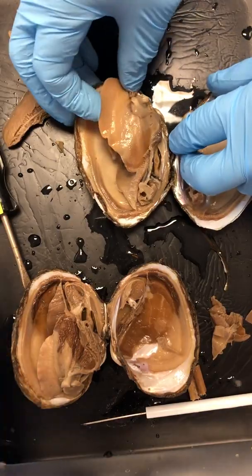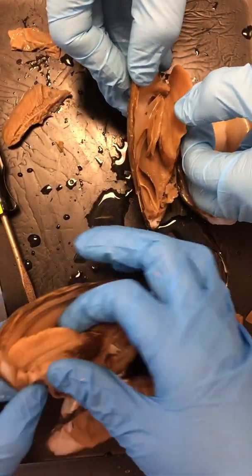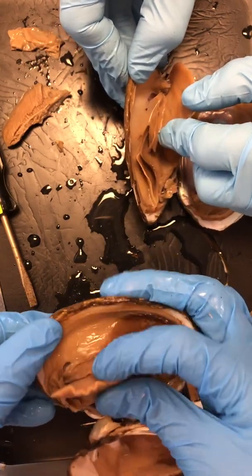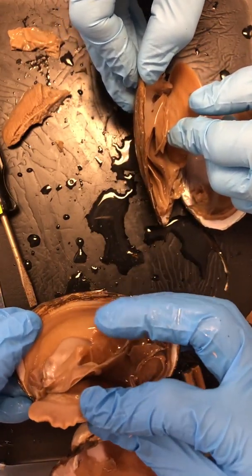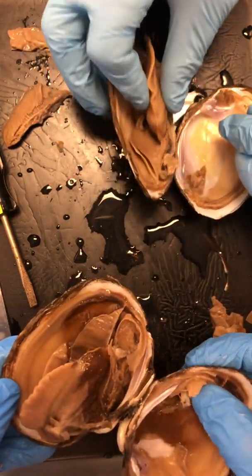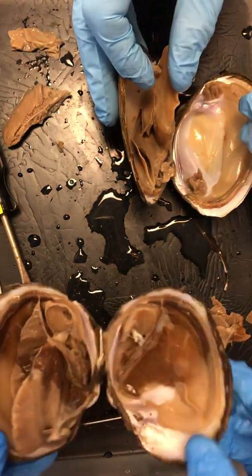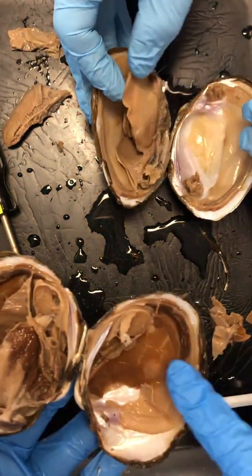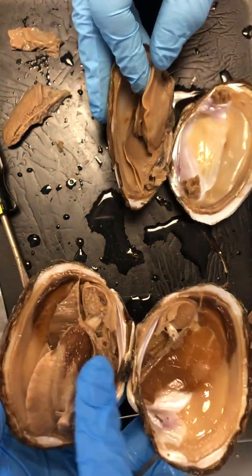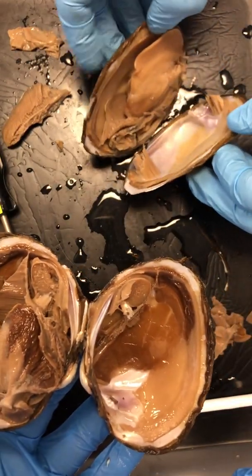Big takeaways for us here, things that we really want to make sure we're feeling A-okay with. This idea of a foot being this big, gigantic monstrosity that pretty much dominates our mussel because it basically controls everything that your mussel can do. No central brain, right? No brain in this guy. Gills for breathing, a hard shell for protection, and a mantle to kind of soften the blow between your visceral mass and your hard shell.